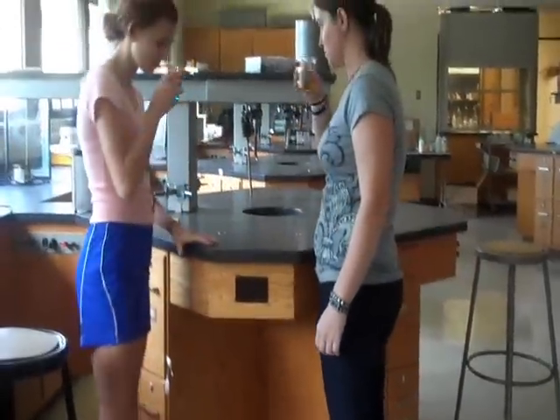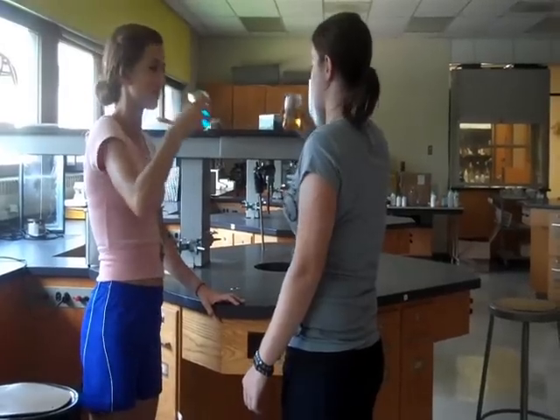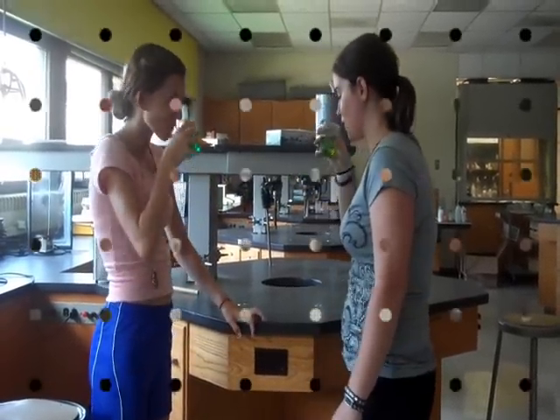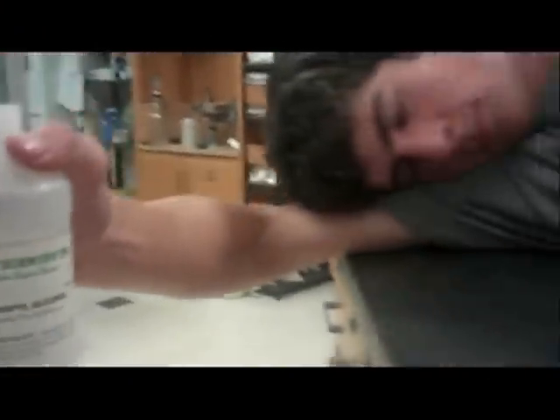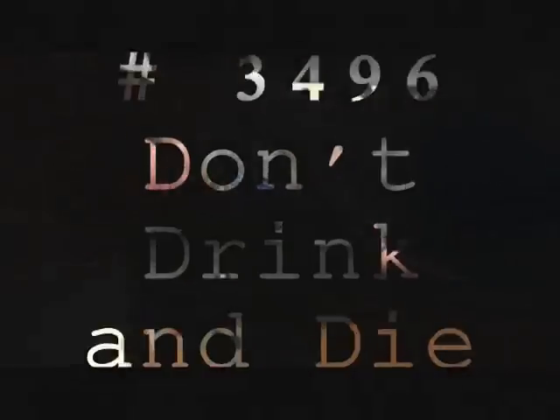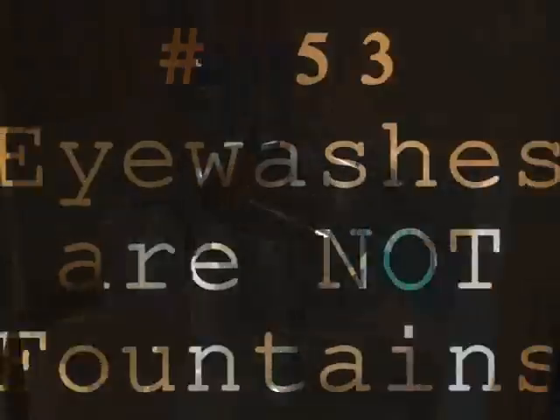Rule number 100: do not smell, eat or drink anything in the chemistry lab unless directed to do so. Do not drink the isopropyl alcohol then pass out on the lab table. There are many bad things that can happen. Rule number 53: do not drink from the eyewash fountain.